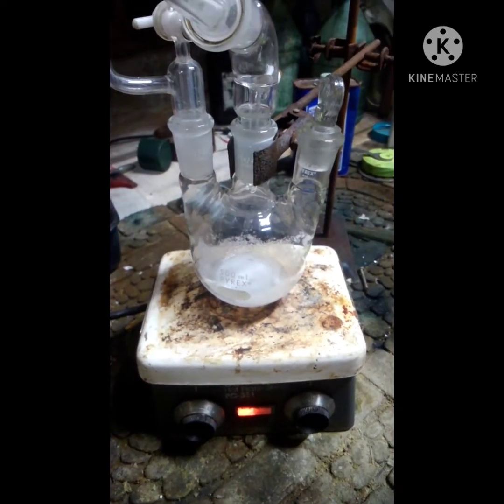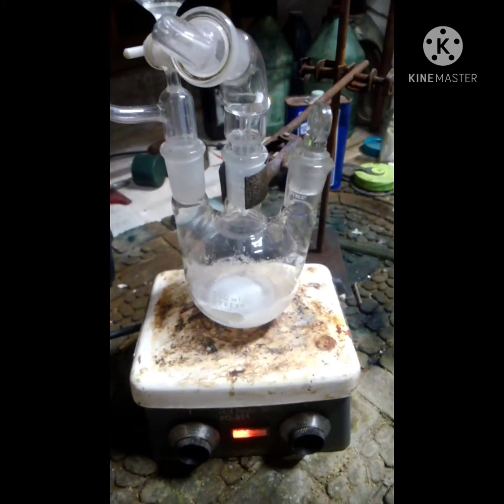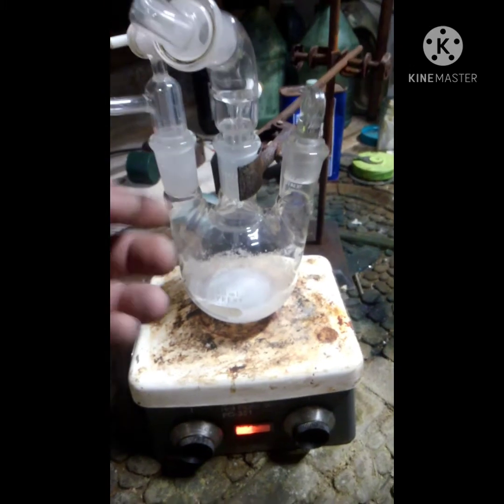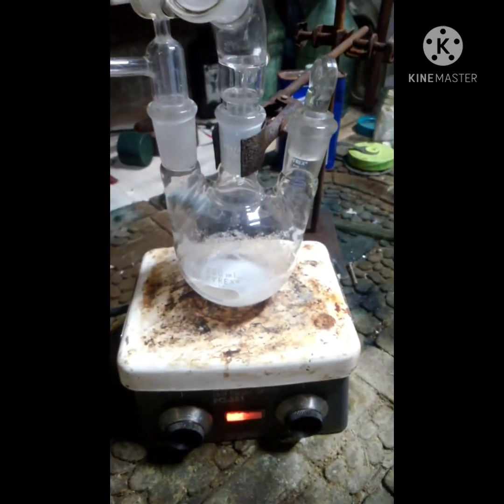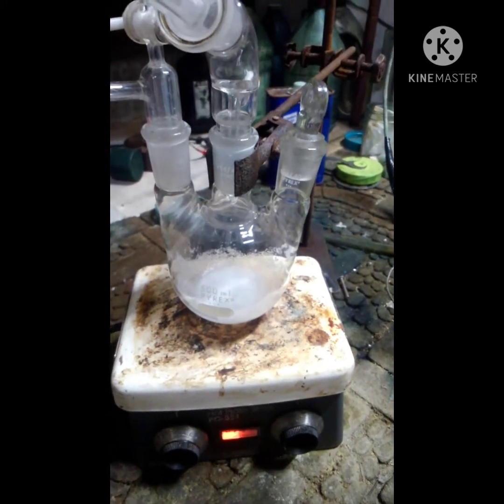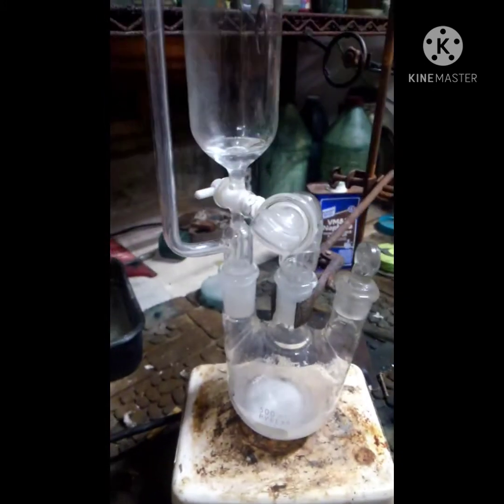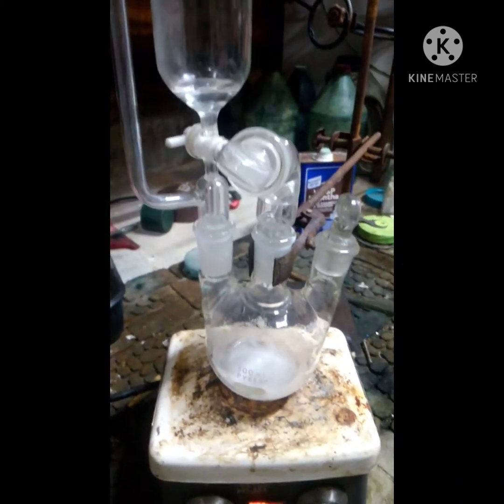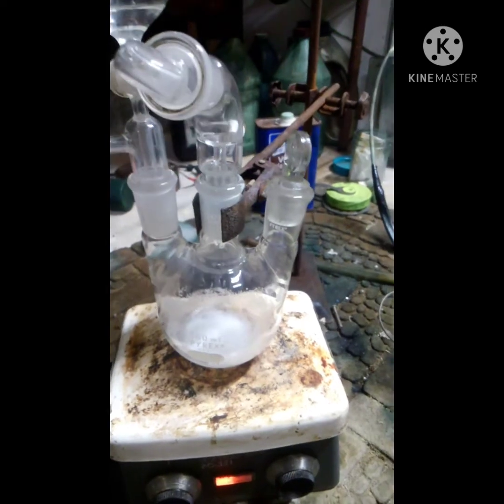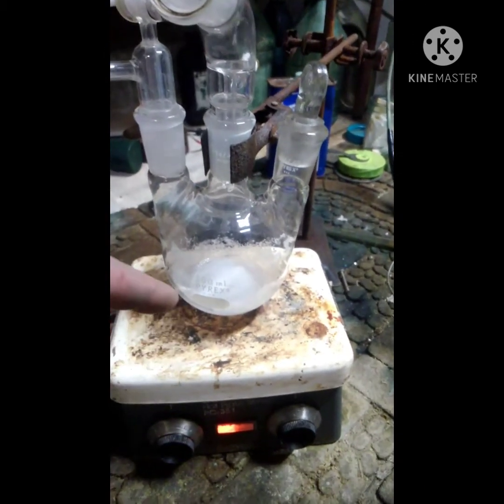Today I'm making sodium triacetoxy borohydride. So far I've got 25 milliliters of DCM and 5.7 grams of sodium borohydride in here, and then in here I have 8.5 milliliters of glacial acetic acid. When you put your DCM and your NaBH4 together, they react a little bit.